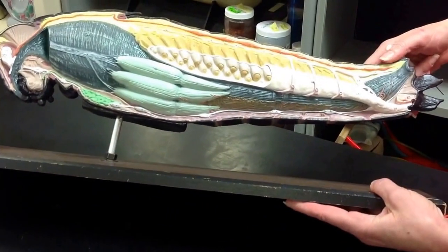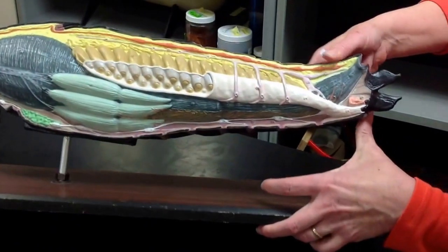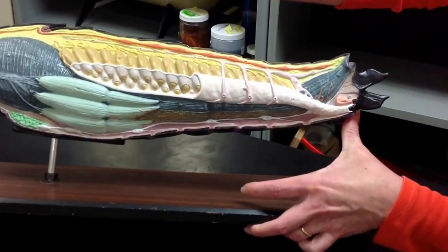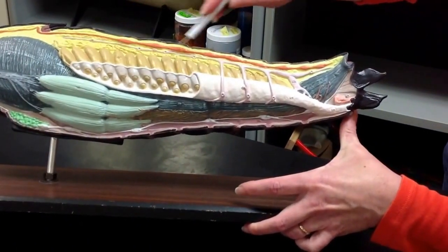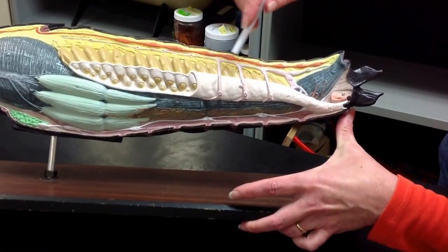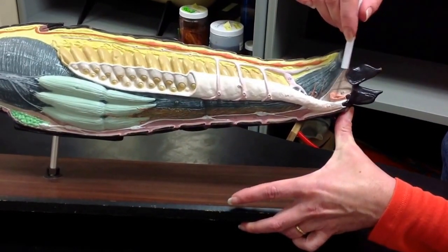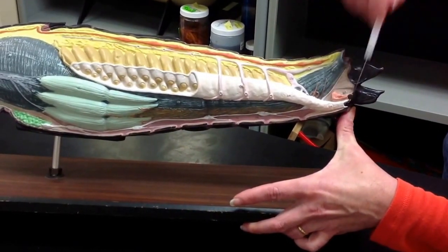This is a female grasshopper, so you have eggs in the egg tube. The egg tube leads to the vagina. The opening of that is the ovipositor.